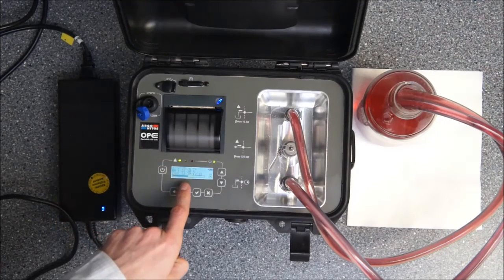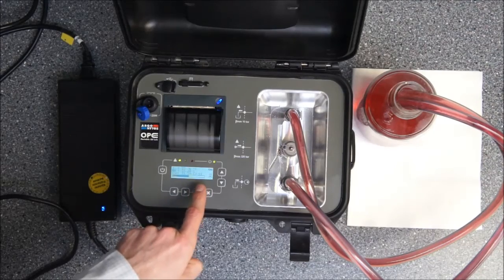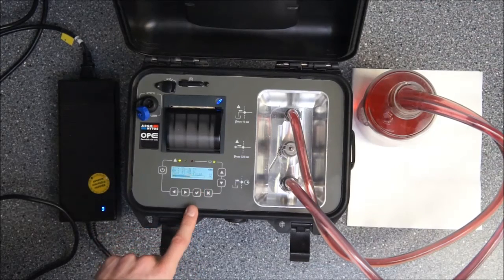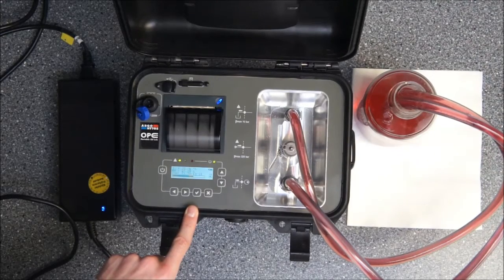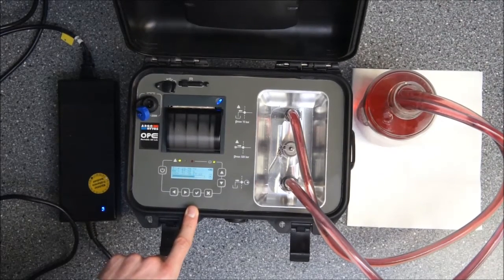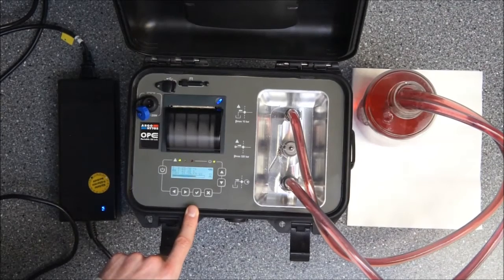You see 4 micron, 6 micron, 14 micron and 21. So the first three digits are representing the ISO 4406C reading and giving you the information about the oil quality.